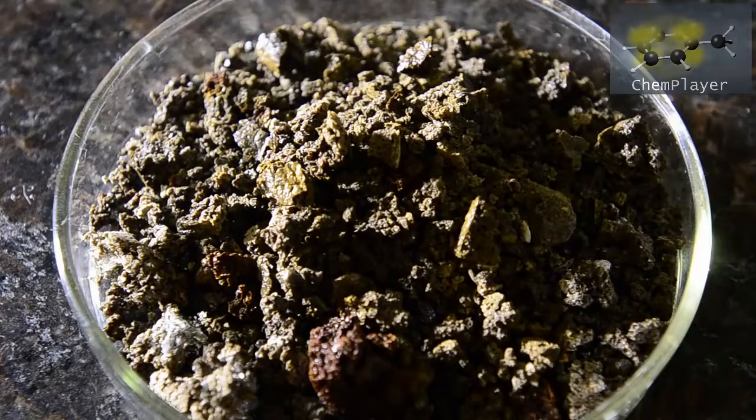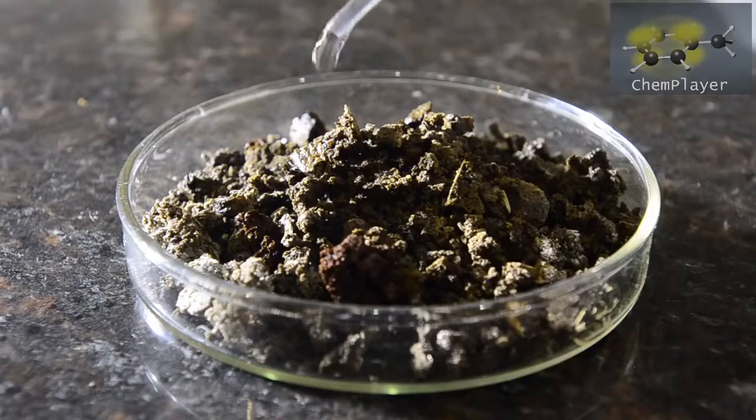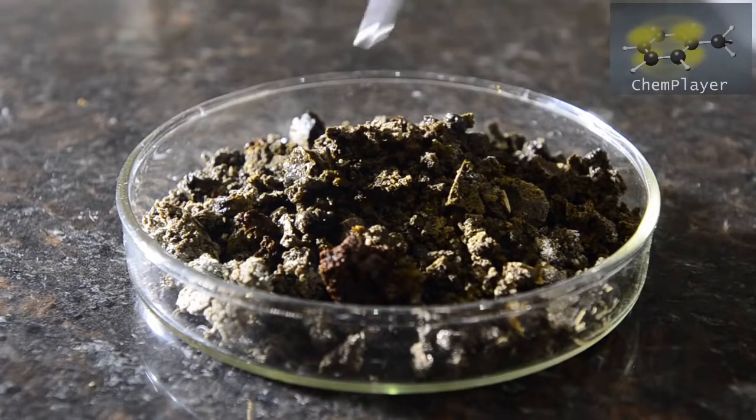It's probably mostly aluminum hydroxide or oxide. We added some water but there was no reaction and no exotherm, and the resulting water mixture is just slightly acidic to indicator.